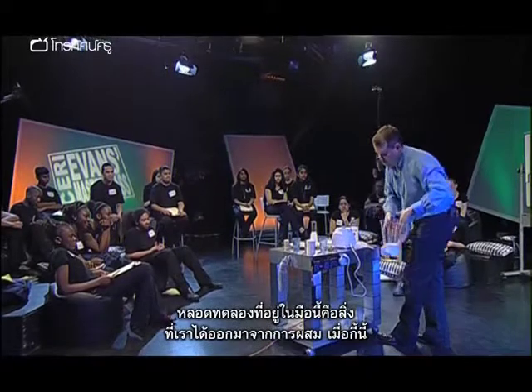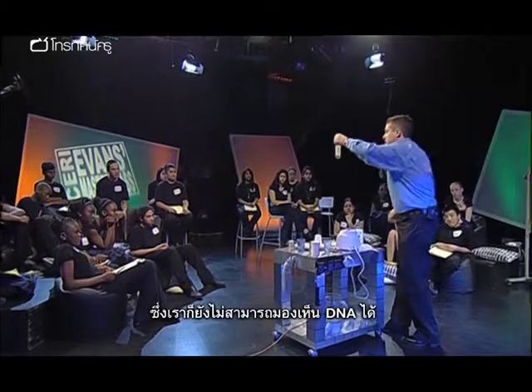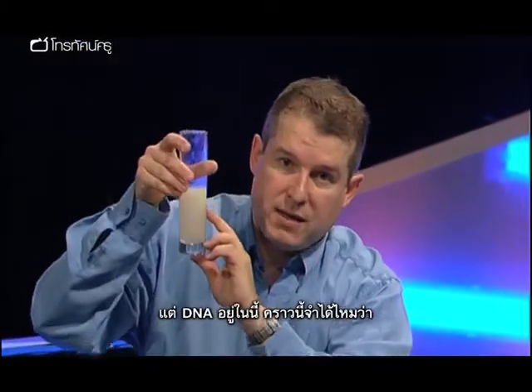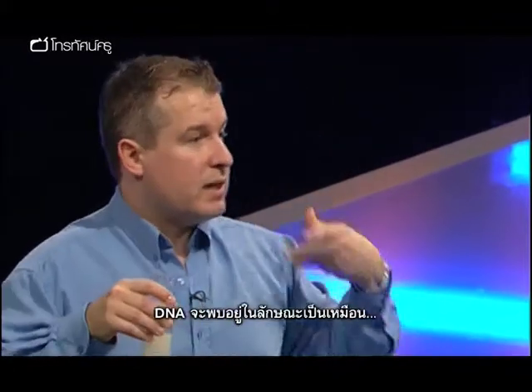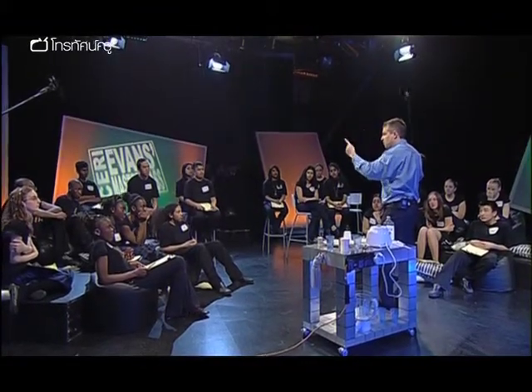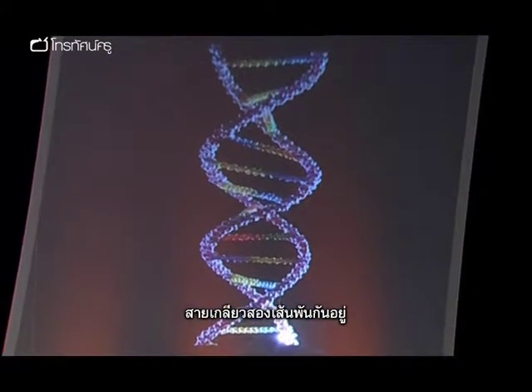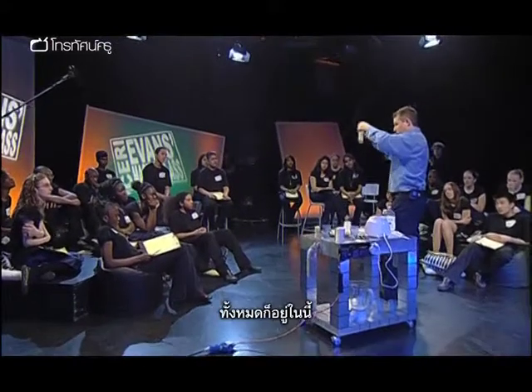If I can show you what I've done earlier, just for clarity, here it is. Again, we still can't see the DNA. But the DNA is present in there. Now remind me — DNA is found as what? A double helix. So DNA is a double helix strand. They're all found within there.